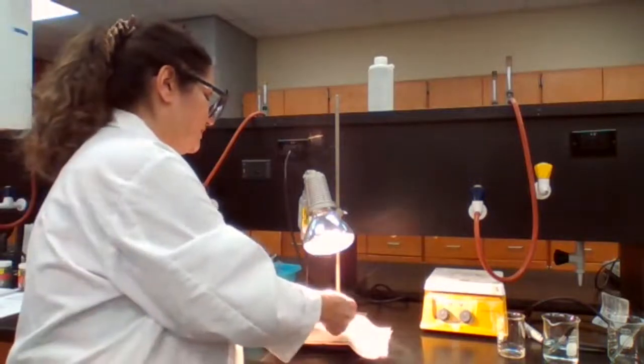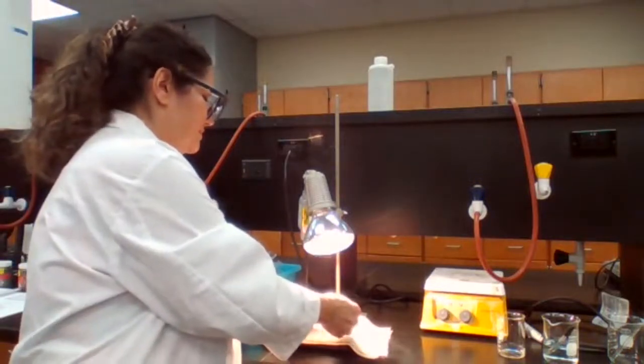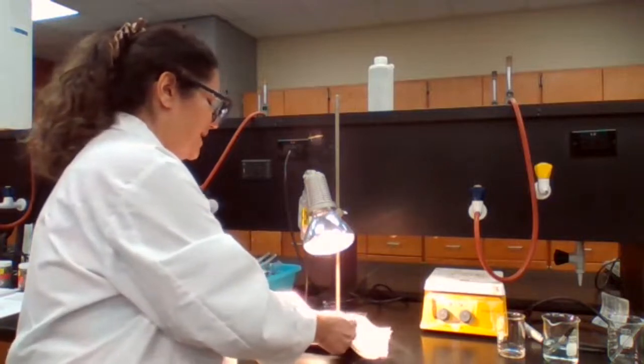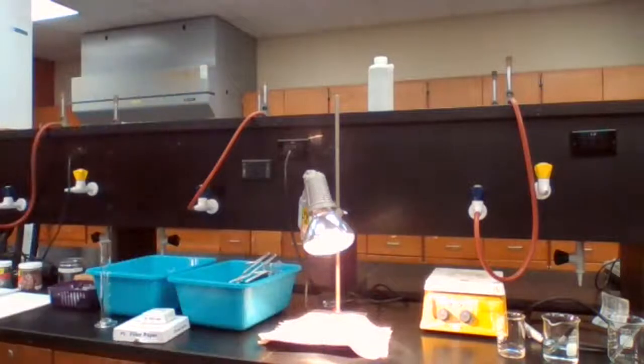I'm waiting for the paper to be crisp. In that case, I know it's dry. So if I weigh now, I tell you what?